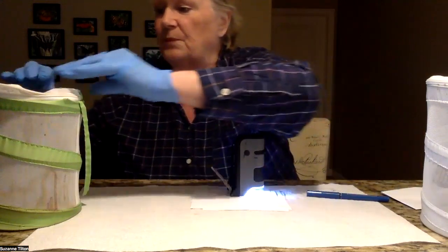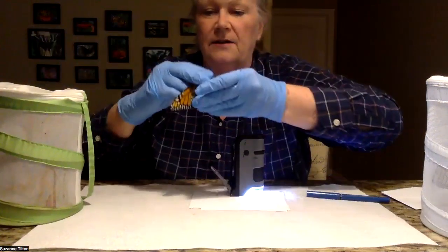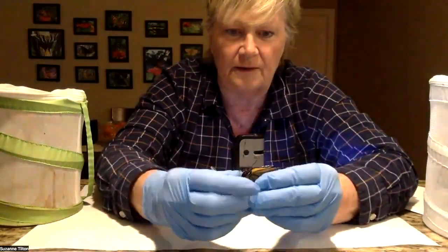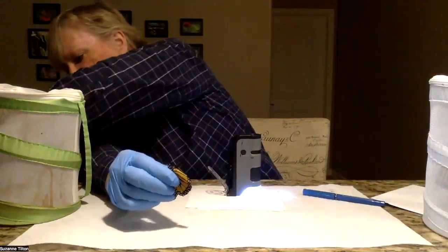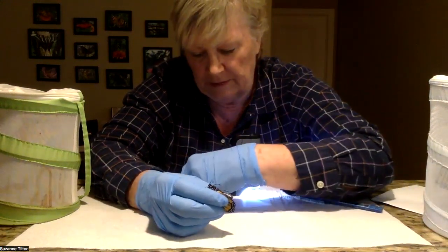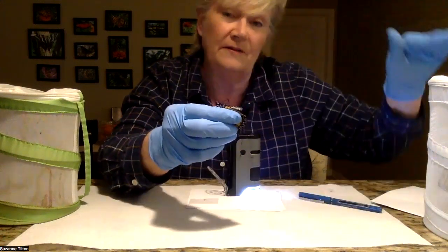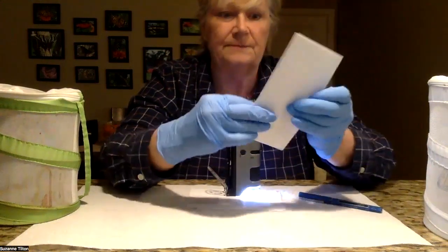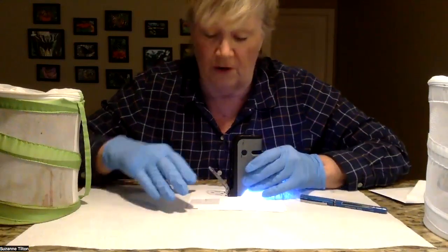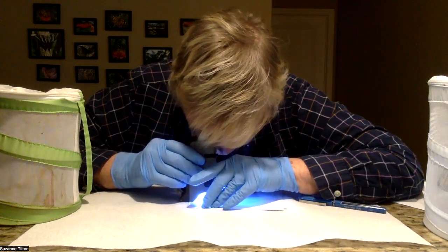Let me show you one more time what I do. I take the butterfly — now, these guys are really wily. Sometimes if they're too wily, you can put them in the refrigerator for about two minutes and they'll settle down. Again, I hold the butterfly and try to get it to extend that abdomen. I take my tape, place it on the abdomen, and place it on the paper. This butterfly I'm going to put in an envelope temporarily because he might have OE and I don't want him infecting the others. And I'm going to check for OE again — clean as a whistle.